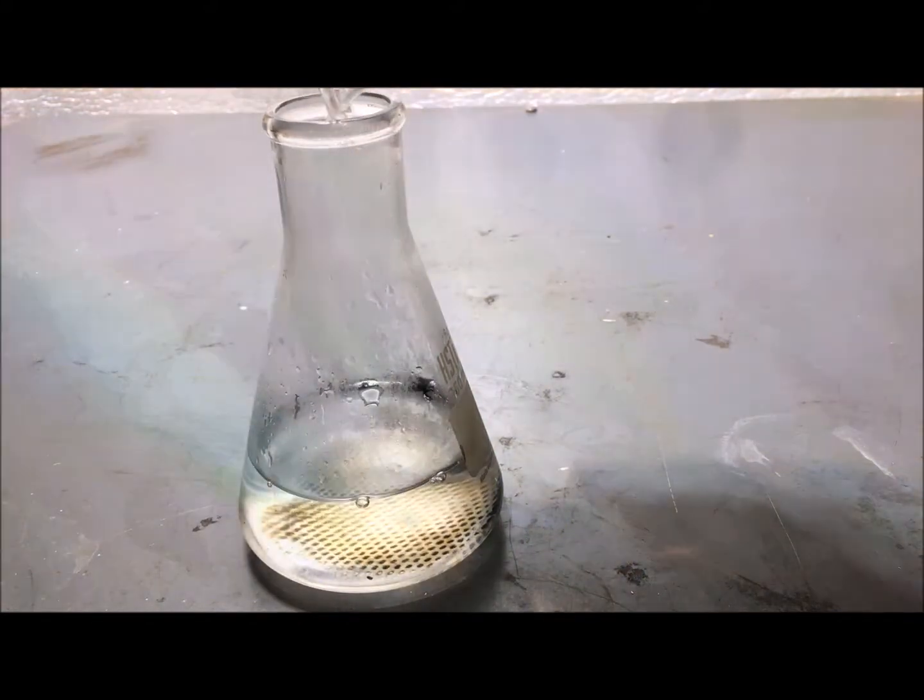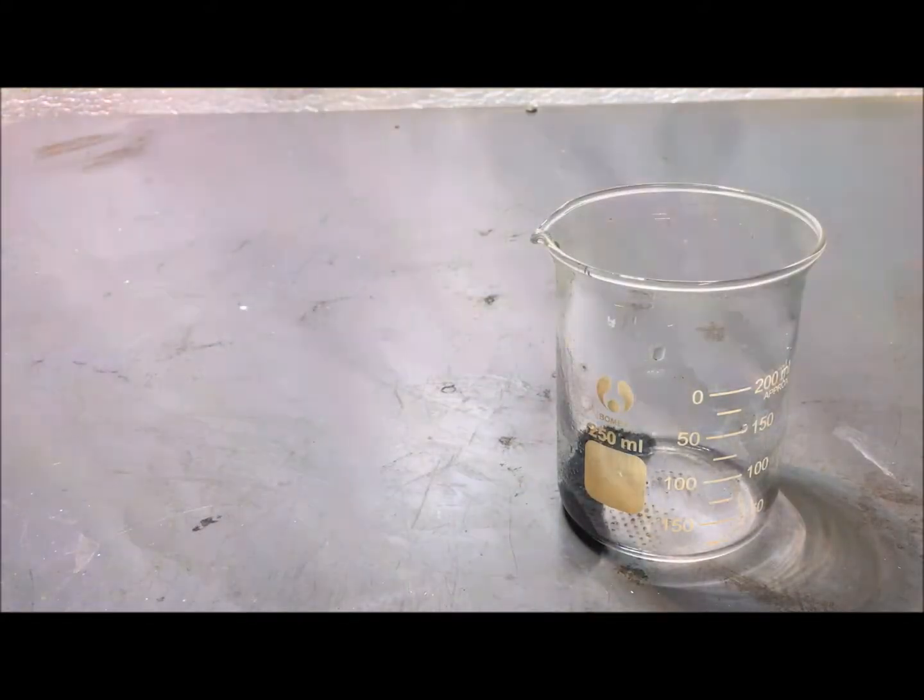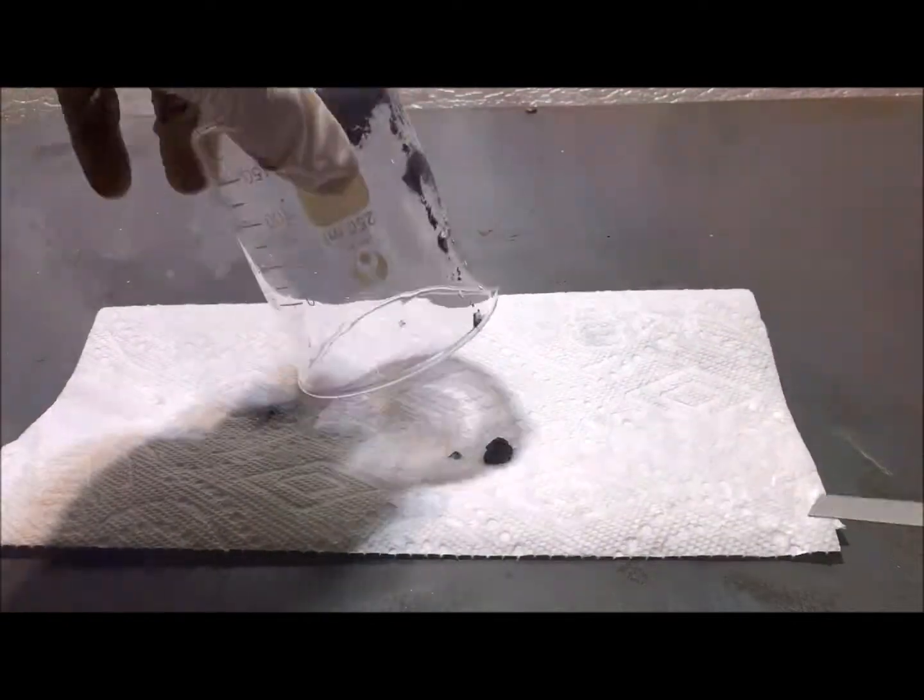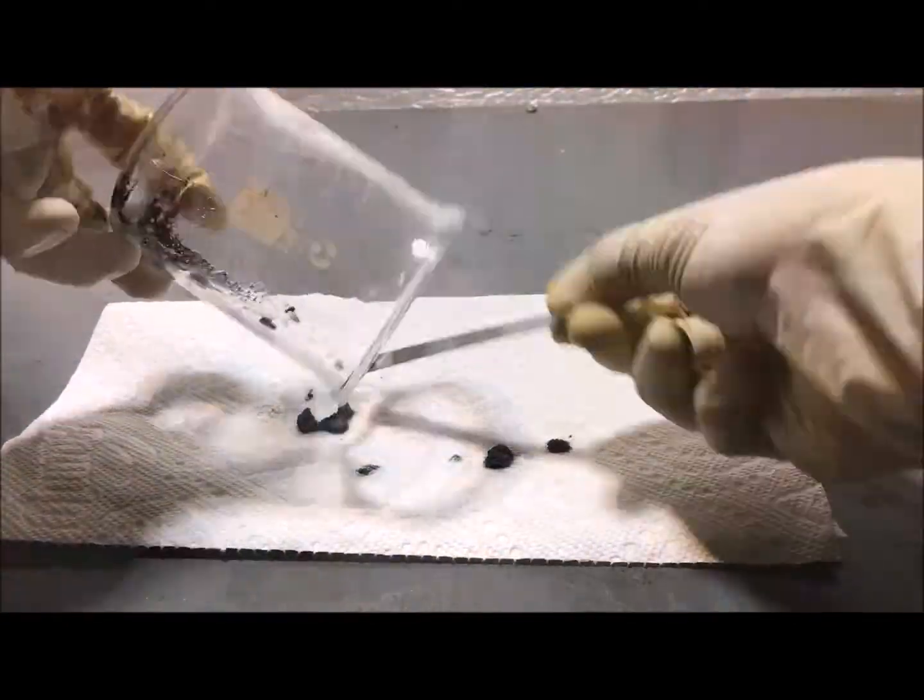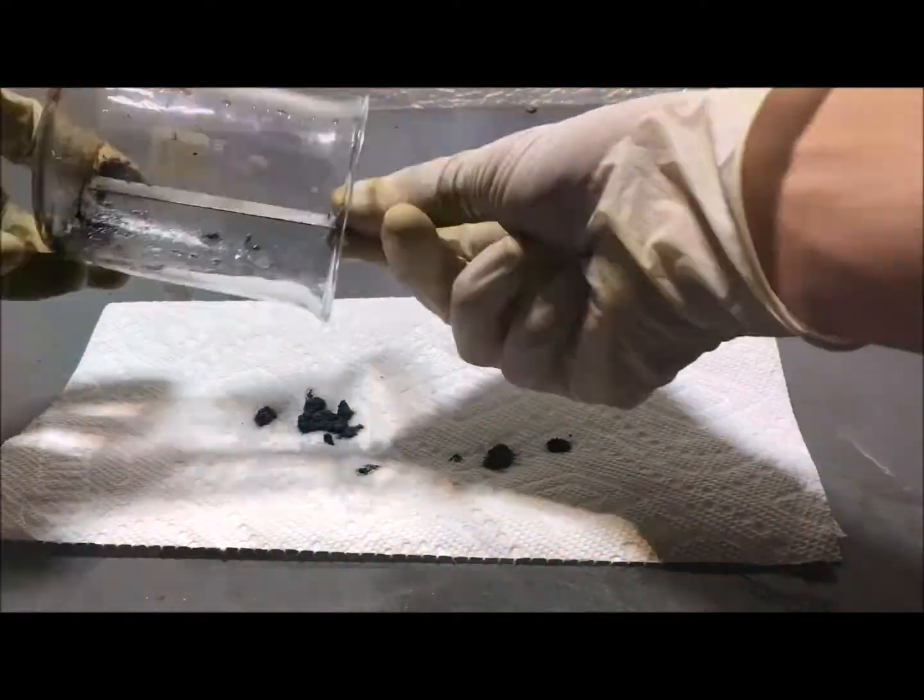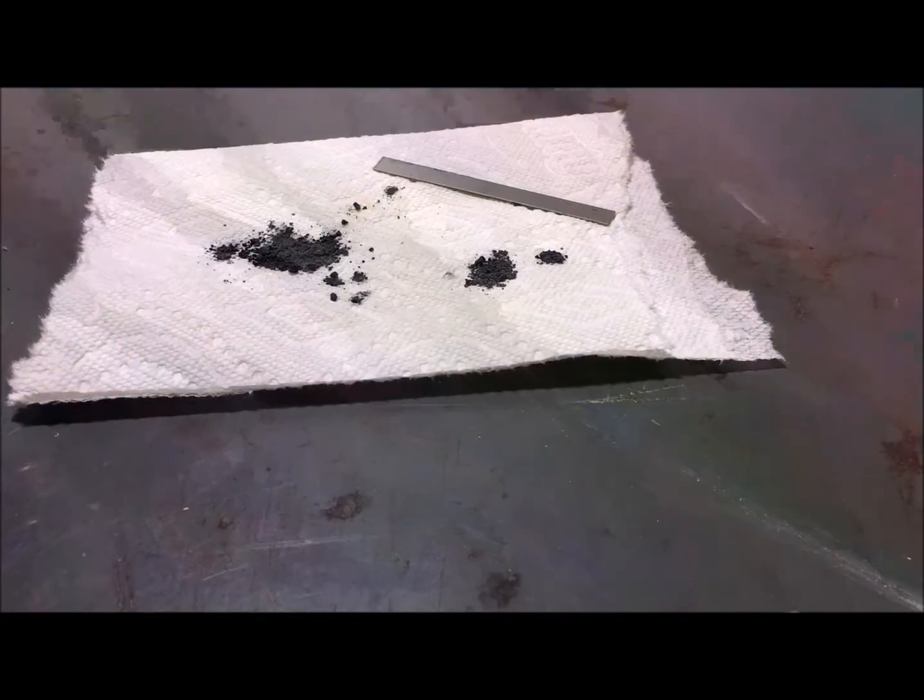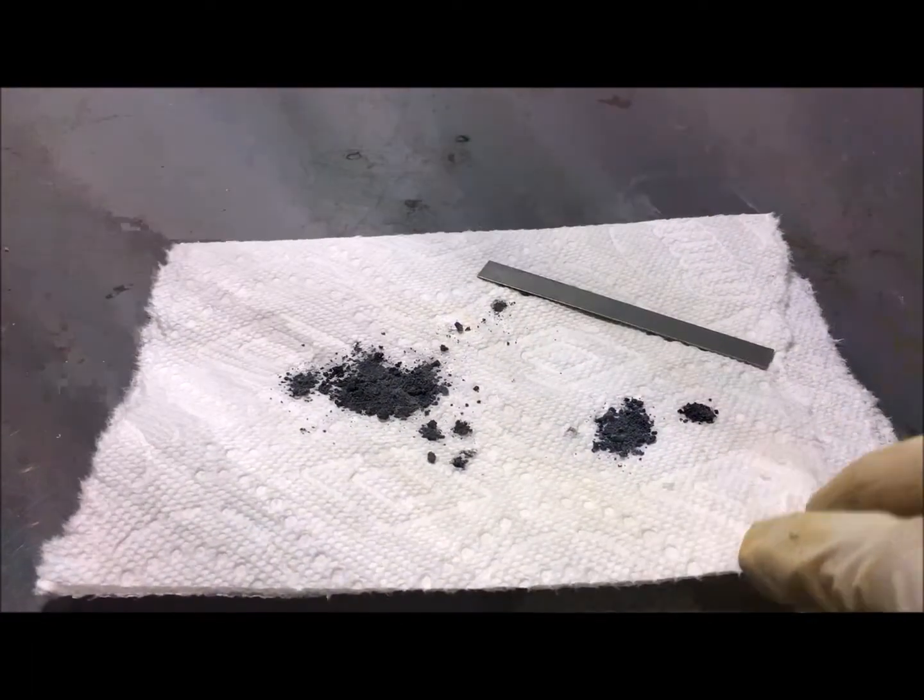After an hour, I removed the electrodes and filtered the solution. After drying the filtrate, we have extremely fine zinc metal powder.